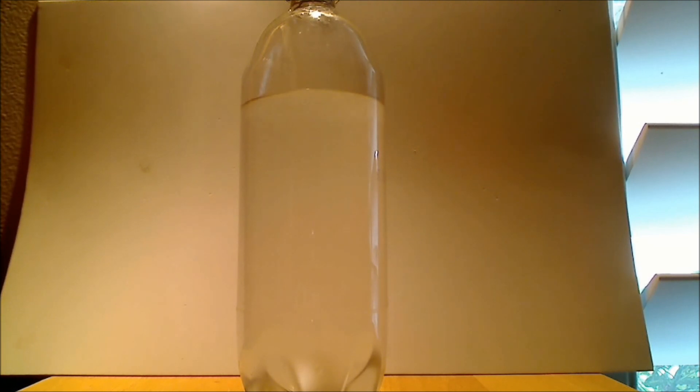You can see now, pretty visible, that it's fairly turbid in character. Let's see what happens with time.